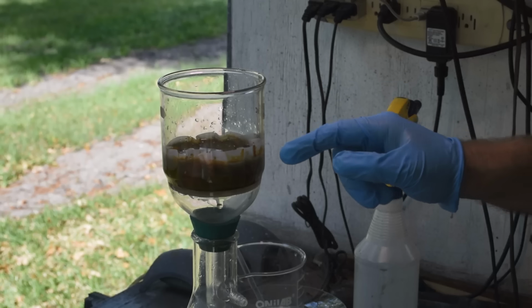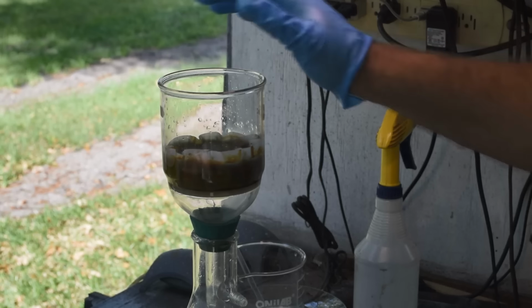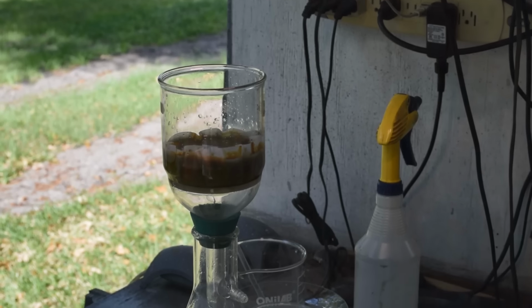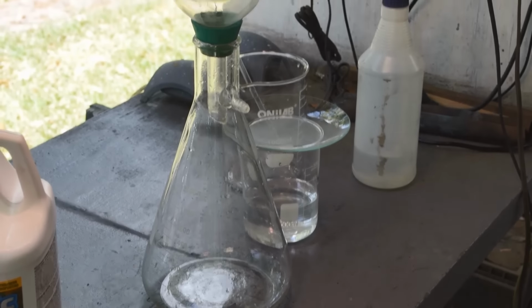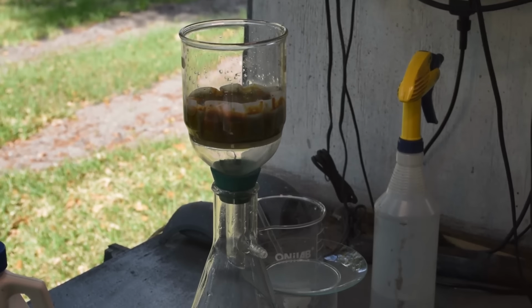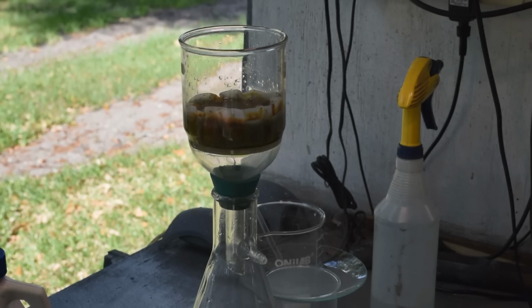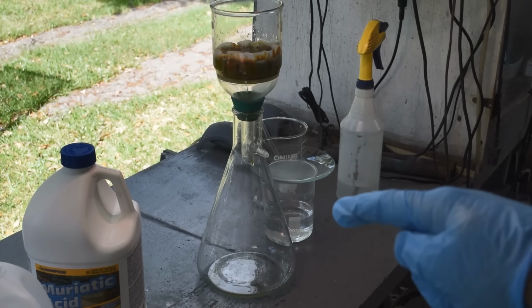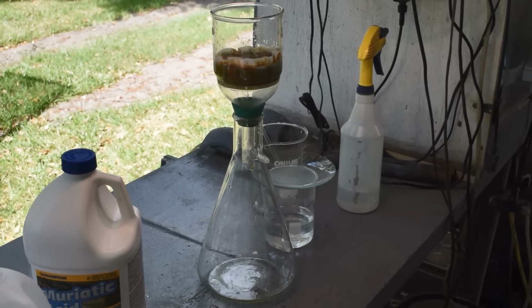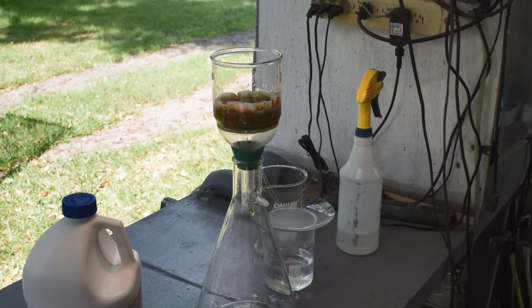And that's going to dissolve all of the metallic hydroxides in here. It's already dripping through slowly. So what I will do is, once this goes down some, I'll put some more of that in it, and I will keep that up until it's all gone through. And then what I'll probably do is dump the liquid in the flask here out back into this beaker and run it all through again, just to make sure we dissolve as much of those metallic hydroxides as possible and get them out of here.